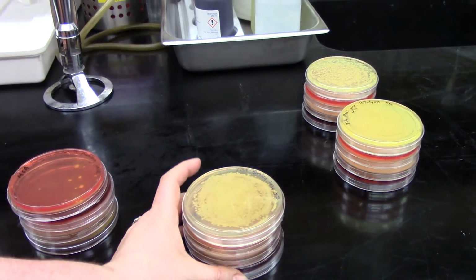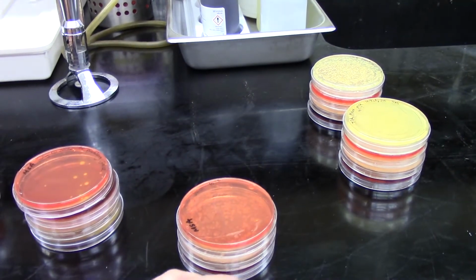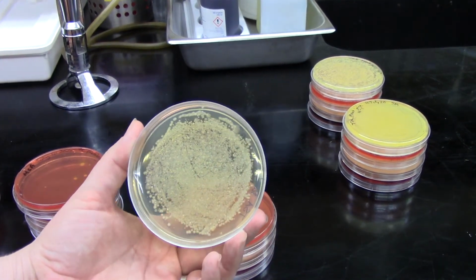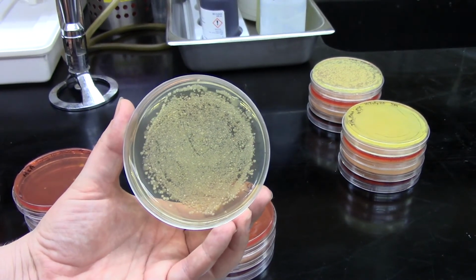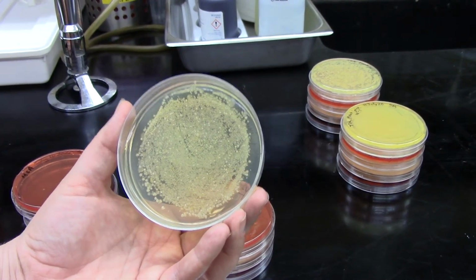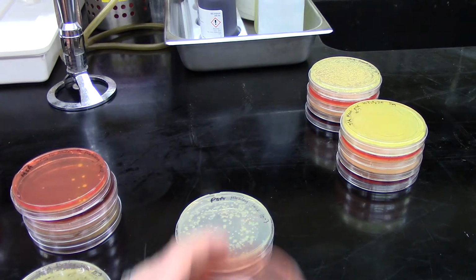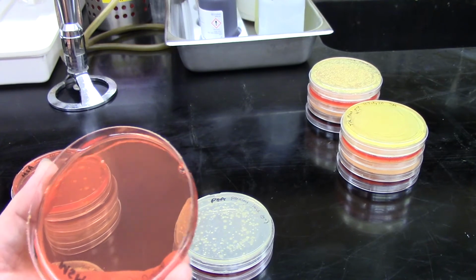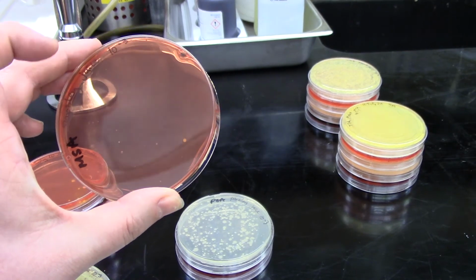We also further diluted our parsley juice, and here we can see a little bit more spread out results. So on our TSA plate, we still have basically a complete lawn of growth. However, we can start to see some different colony types, and I'm seeing at least 3 different types. I'm going to give this to you guys as a photo as well, and hopefully you'll be able to see some of that. On our MSA plate, we still have just one of those colonies that has that yellow clearing around the media.